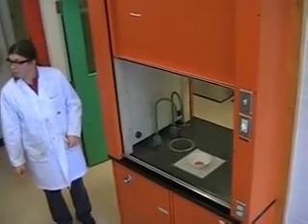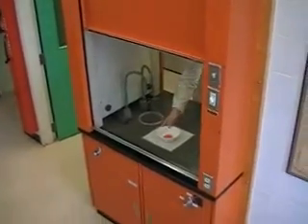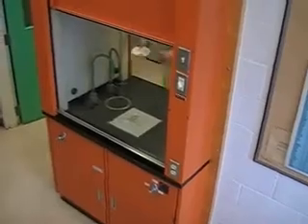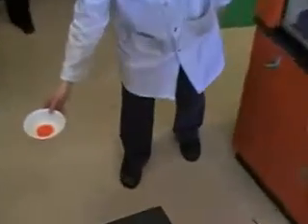Could you just tip it up so we'll get to see what it looks like? Bring it out, because it's not giving off fumes at the moment. You can see it's a very bright orange colour and it's crystalline. This is ammonium dichromate.